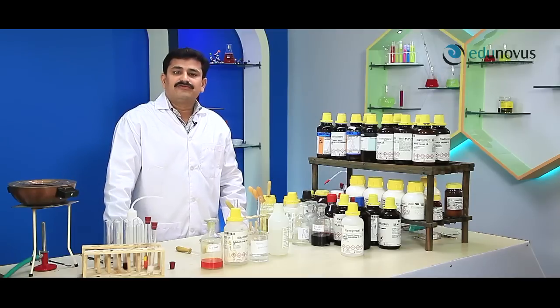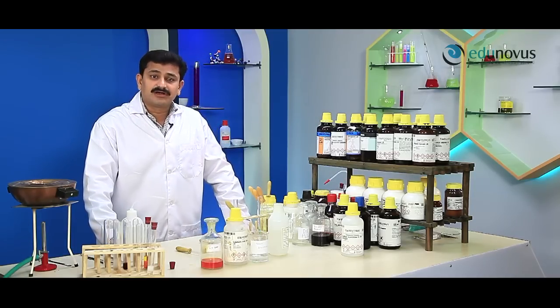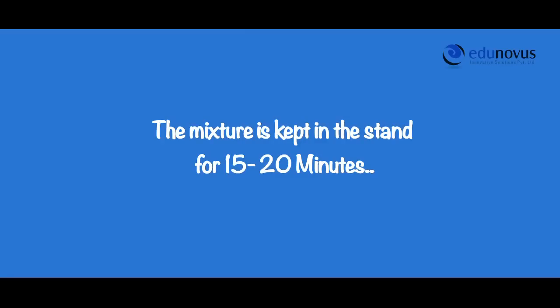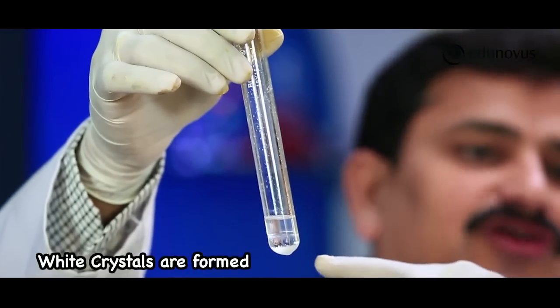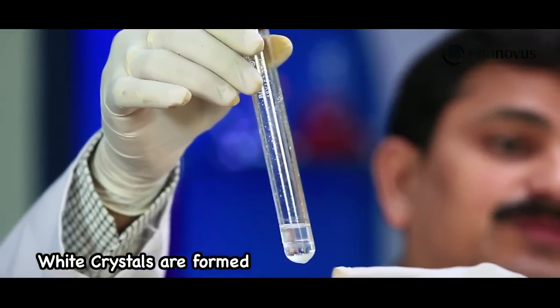The formation of white crystals confirms the presence of the carbonyl group. After 15 minutes, you can clearly see the formation of white crystals, which confirms the presence of the carbonyl group.